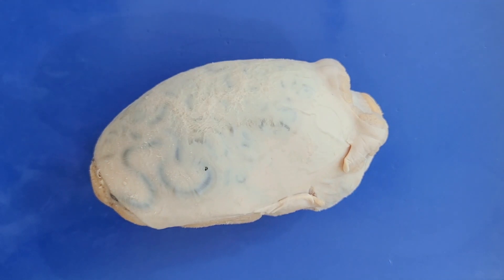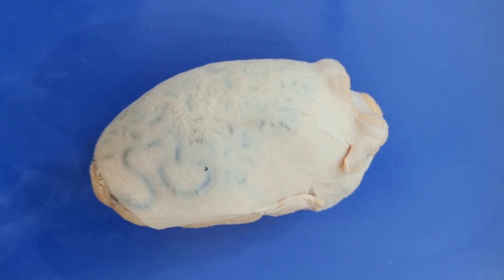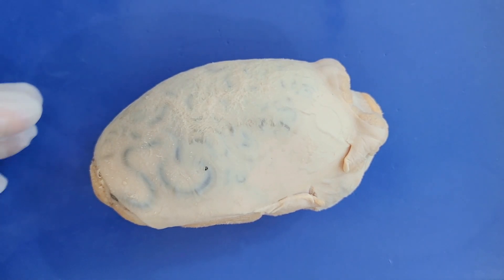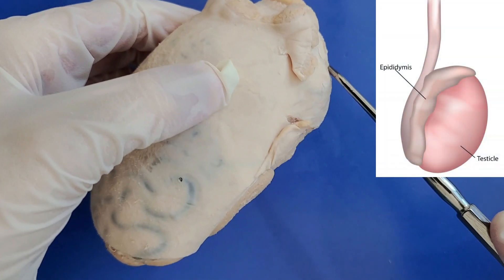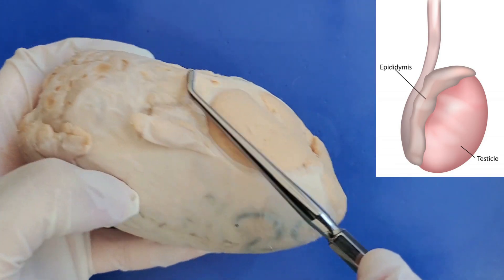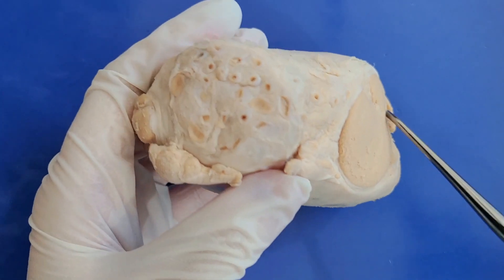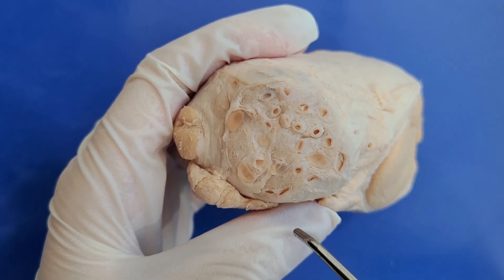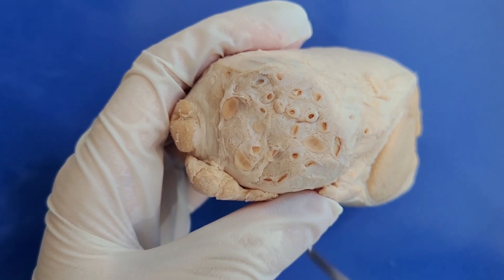Now let's take a look at the external anatomy. This is only the testes, so we won't be able to see the epididymis or vas deferens. This section would be where the testes leads out into the epididymis, and the epididymis actually curves down and connects to the side here. Here you can see the cross sections of the efferent ductules — these little holes here — which are the 12 to 15 small tubes that connect the testes to the epididymis.